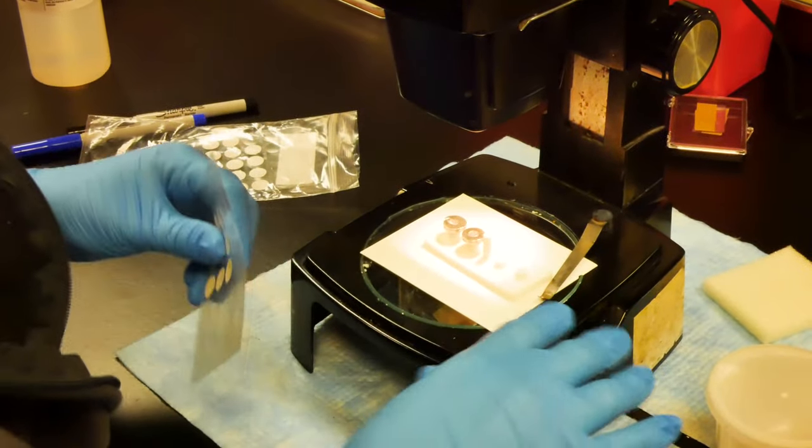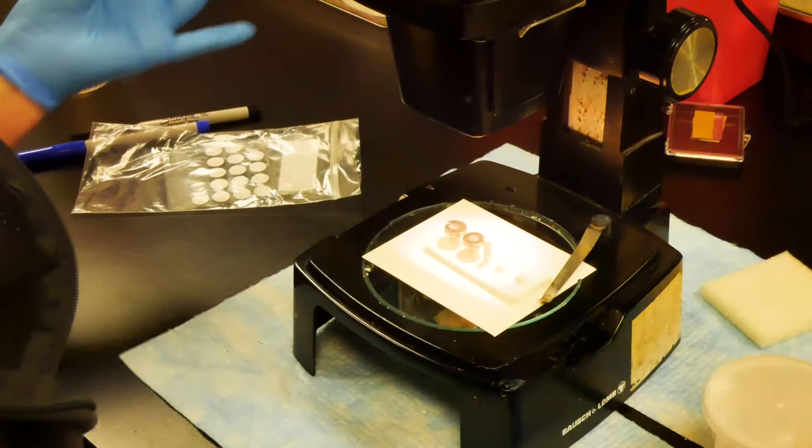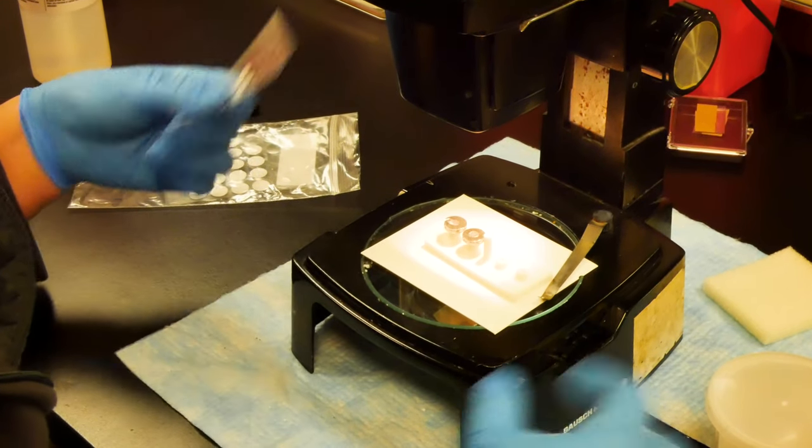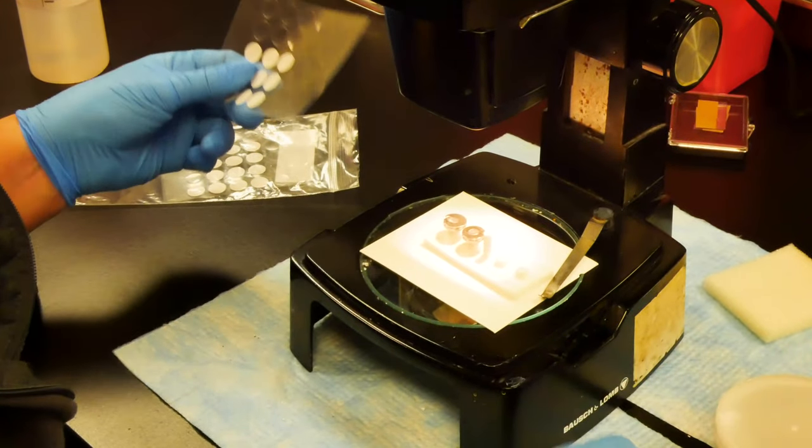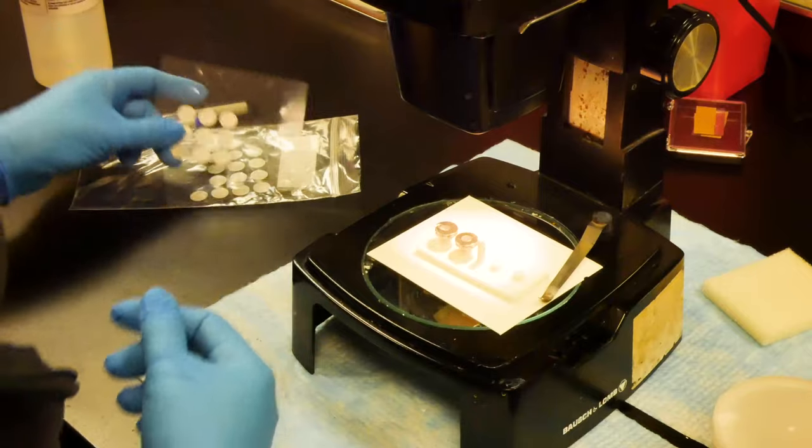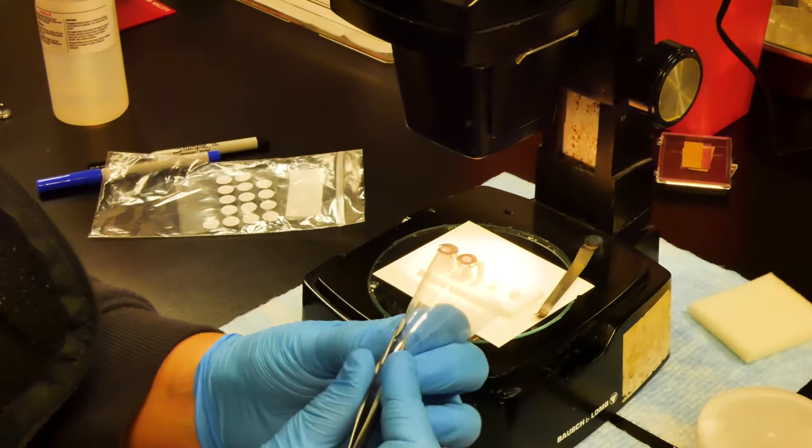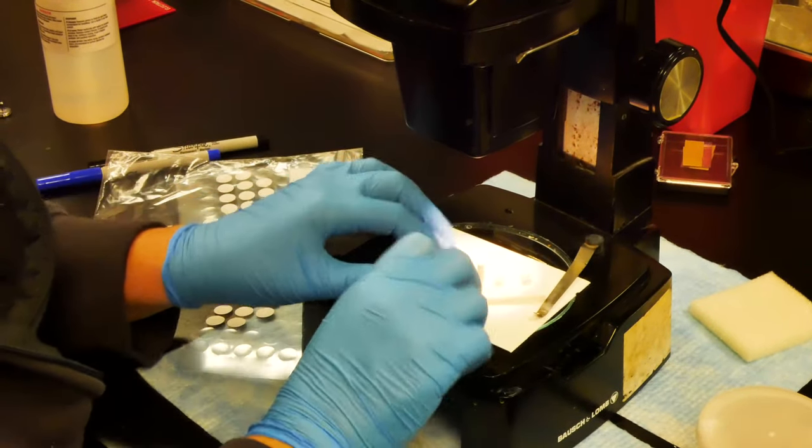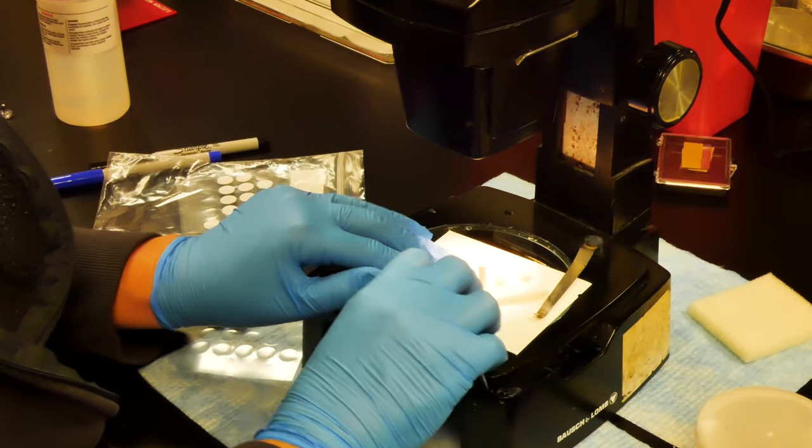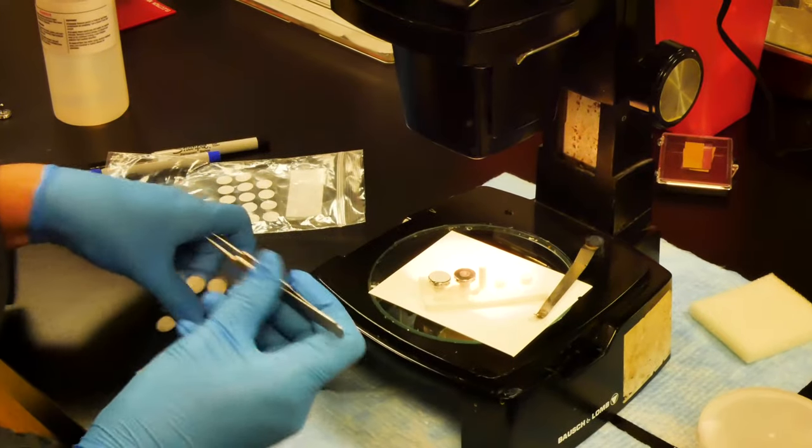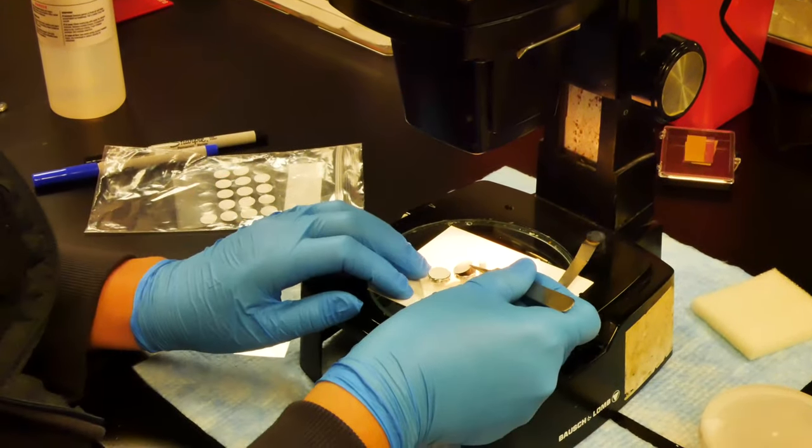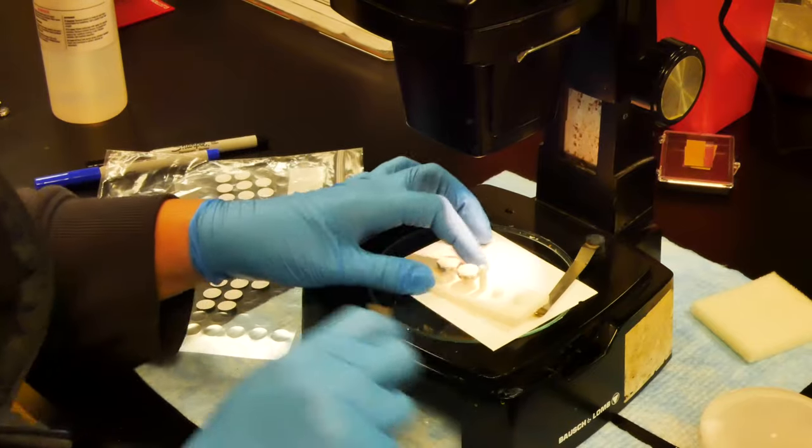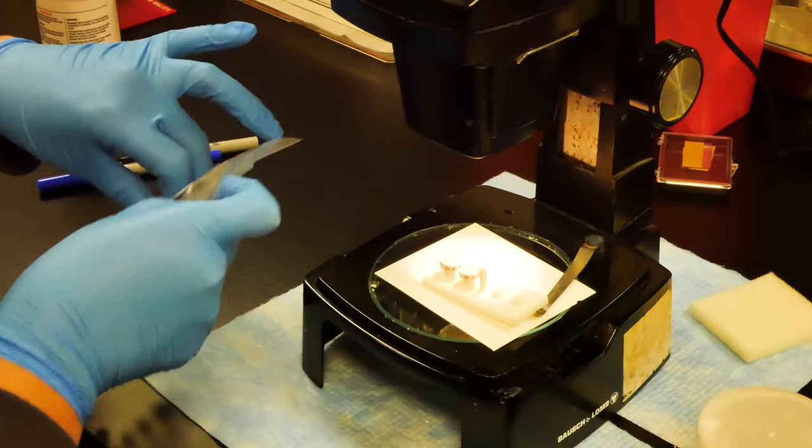We want to work as quickly as possible with the samples out in ambient air because we want, since we have spent the time drying the samples, we want to avoid any additional humidity going back into the sample prior to going on the SEM. I will lift up the double-sided tape and apply it to the edge, and then using the flat end I will apply pressure to make sure it makes good contact with the stub, leaving the cover on it until I am ready to apply the sample.